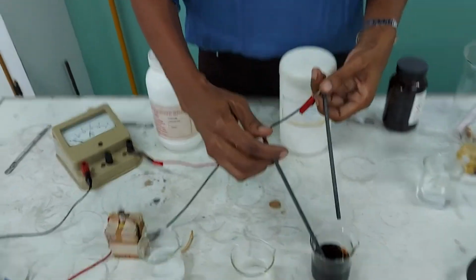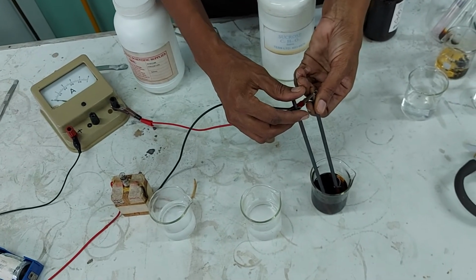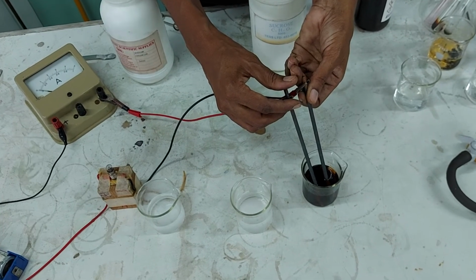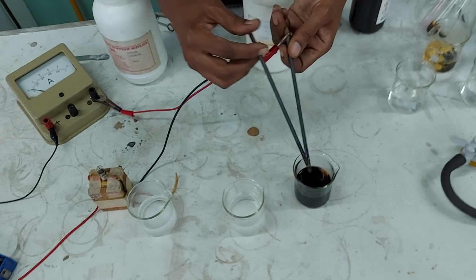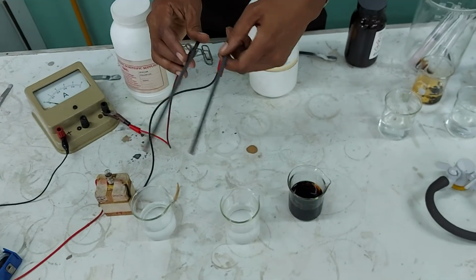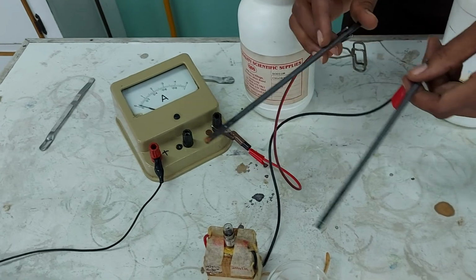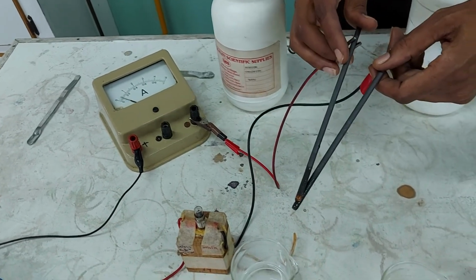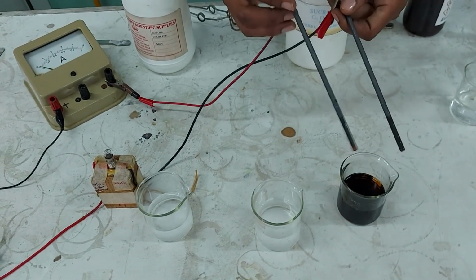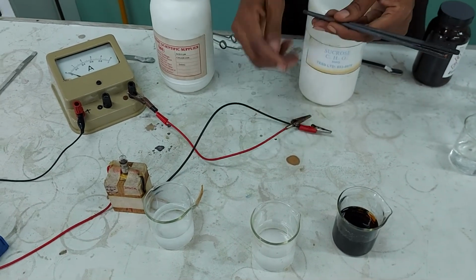Okay, so I'm going to try, let's see. Is my iodine conducting electricity? So you tell me what's going on there. Okay, now just to show you, right, if I take my electrodes and I touch them, there is some conduction of electricity going on there. I separate them, none. So once my electrodes are not touching and they're in a substance, right, you should see a difference when it is conducting as opposed to when it's not conducting.